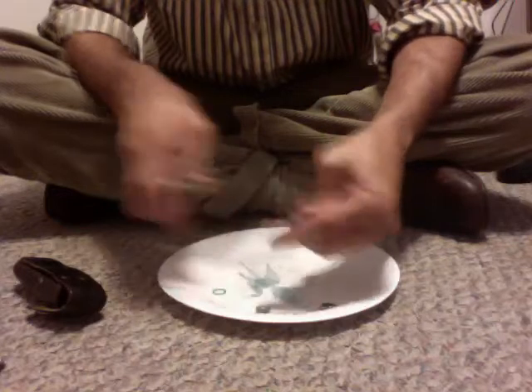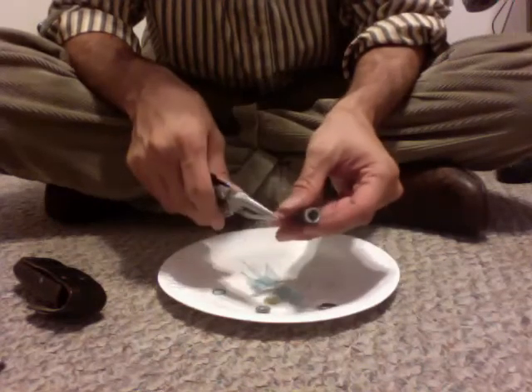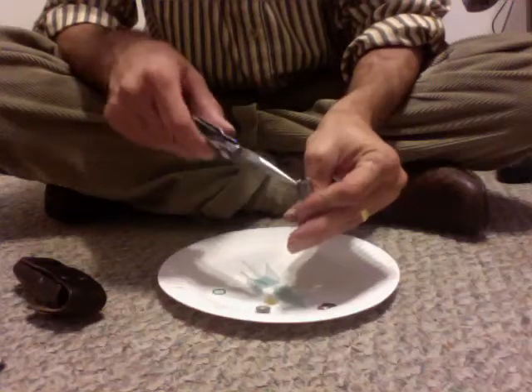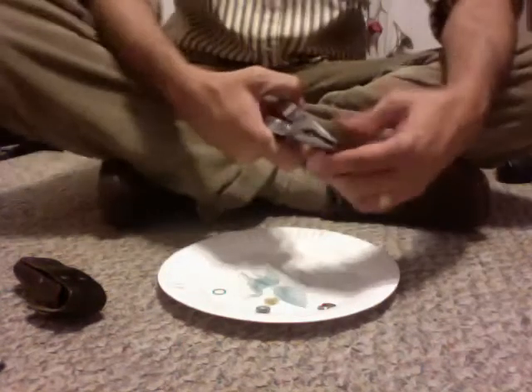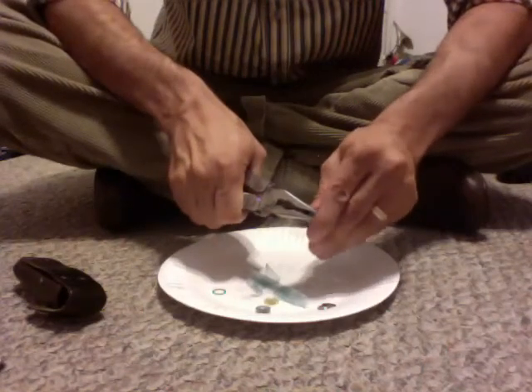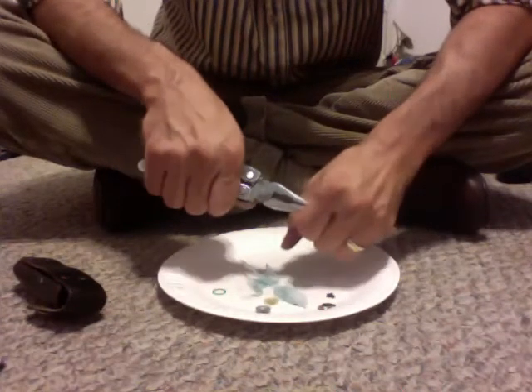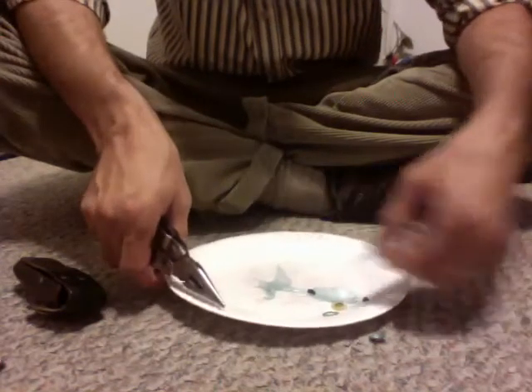This time the cap didn't come out. So I'm going to pull off that plastic piece — you can see inside here, there's the carbon rod. And then down inside there's some paper. This looks like oxidation of some sort. I usually grab the carbon rod and carefully twist it — oh, that shattered, so it's not going to work this time. Sometimes this rod will pull out, but that's totally not going to come out. So that's all right.